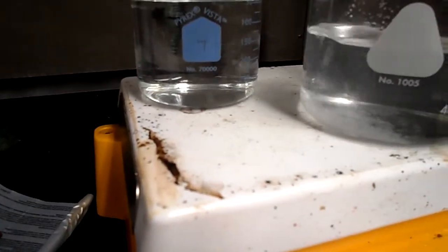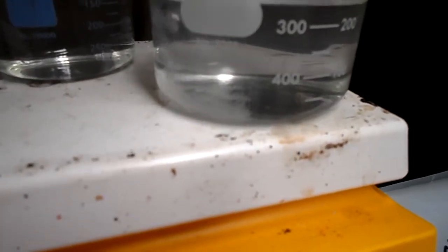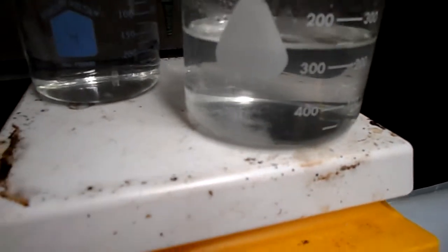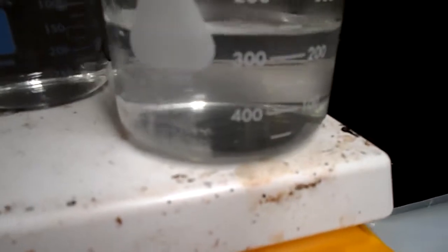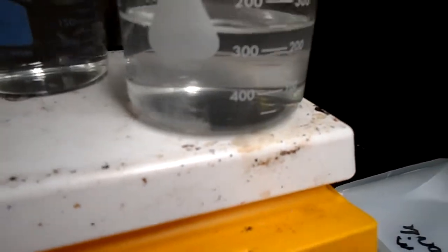Without even stirring, you can see that the salt is dissolving, and actually the sugar is almost dissolved as well. It's just taking a little bit more time. So I will come back to that in just a second to make sure. But 100% salt is dissolved. Oh, there it goes. The sugar is dissolving. So for boiling water, the solubility is yes for both.